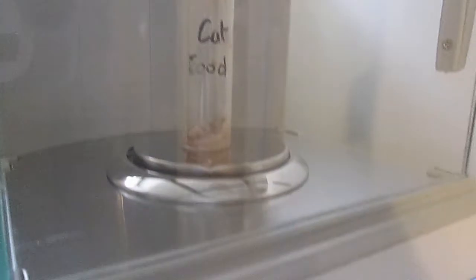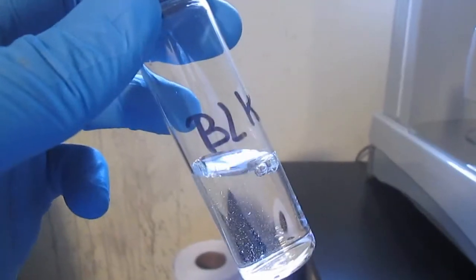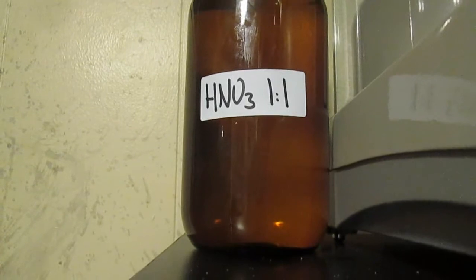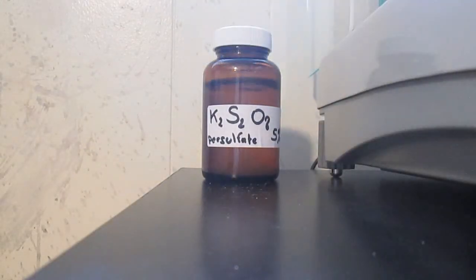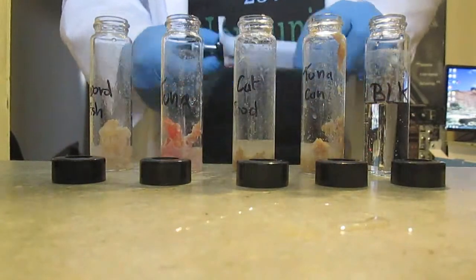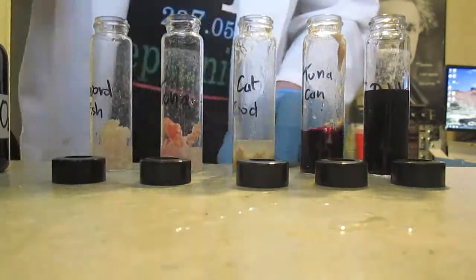The sample requires a few steps and this is what I came up with. I weigh out about 5 grams of sample and a blank, and add 1.25 ml of 0.5 normal sulfuric acid, 0.75 ml of 1-to-1 nitric acid, 2 ml of a 5% potassium persulfate solution, and 3.75 ml of 5% potassium permanganate. All these oxidizers are necessary to get mercury into the same oxidation state and reduce interference due to copper and chlorine.